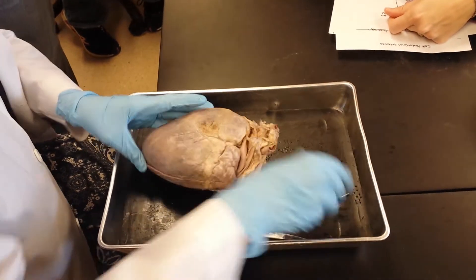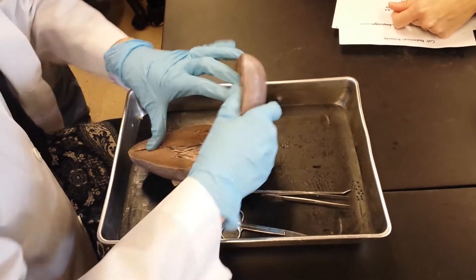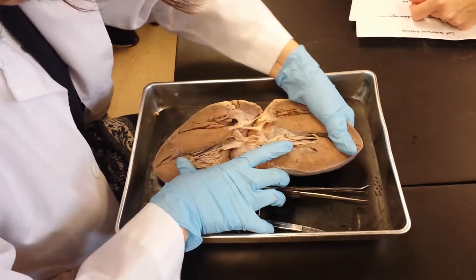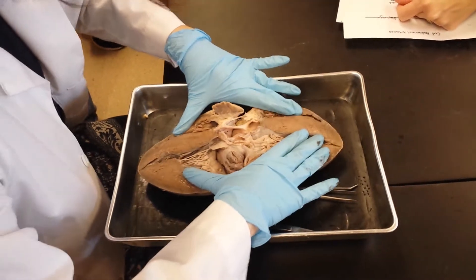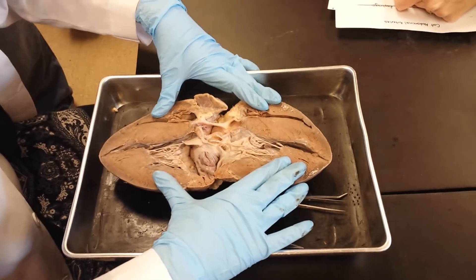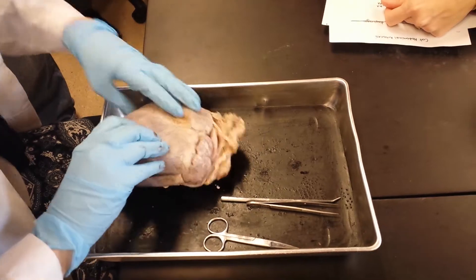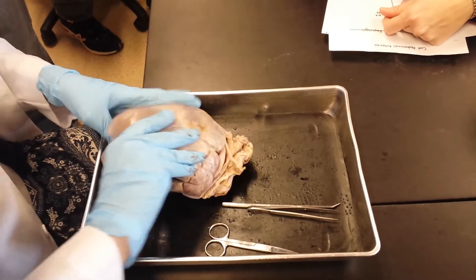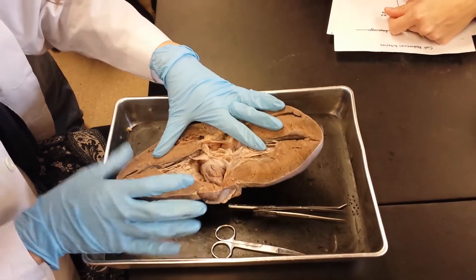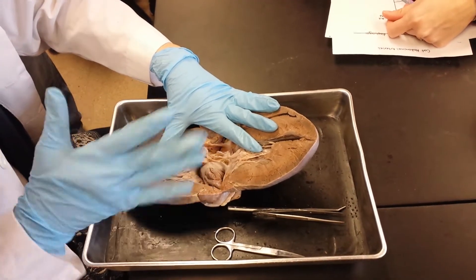So we're looking at the anterior again and I'm going to open up the anterior. This is a frontal section. How do I tell my left side? The left side is bigger. So when I have my anterior here and I open it up, this is my left side, and it's the patient's left side — it's going to be on my right.